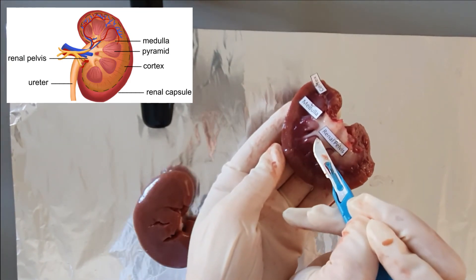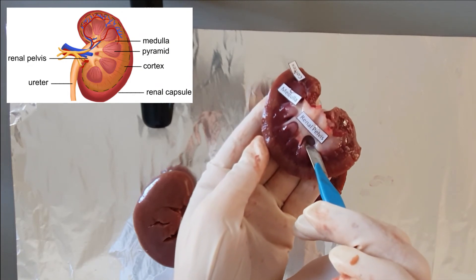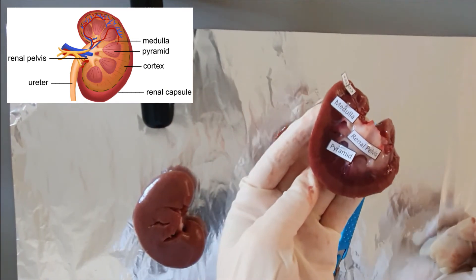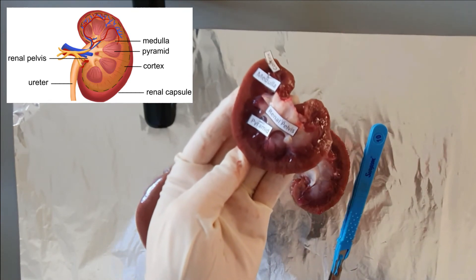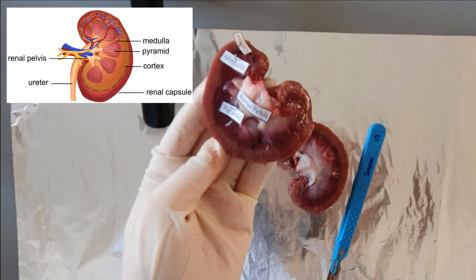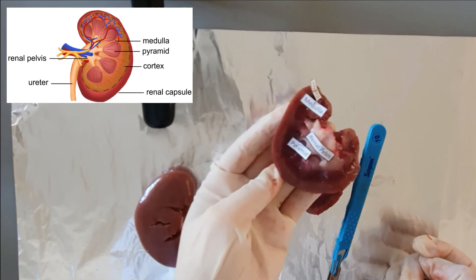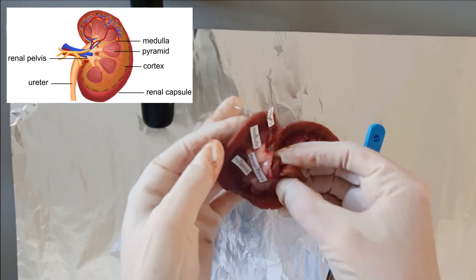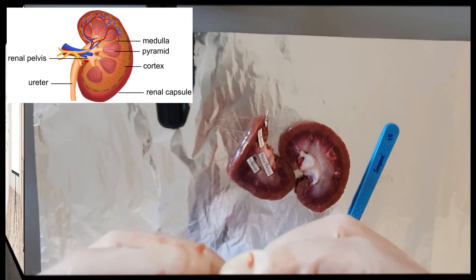Let's have a closer look at the renal pyramids as you can see here. To recap: the internal structure of the kidney consists of two main regions — the cortex and the medulla. The cortex is the outermost layer of tissue in the kidney, situated beneath the renal capsule. The medulla is a darker region of tissue below the cortex, divided into triangular structures called pyramids.